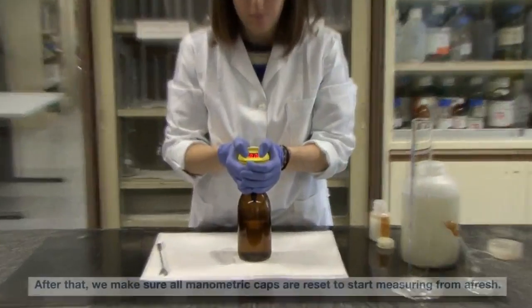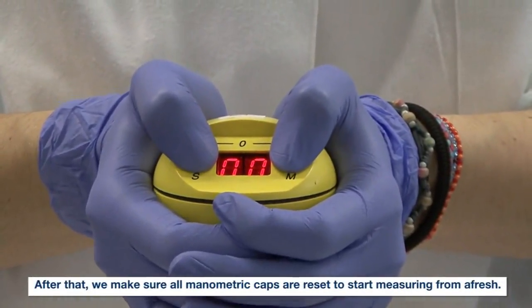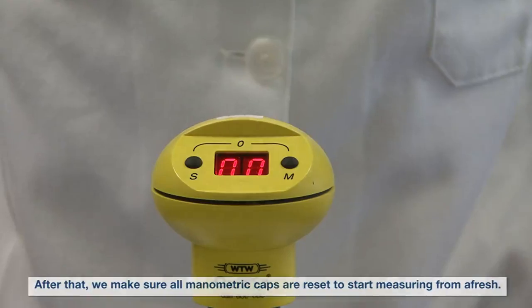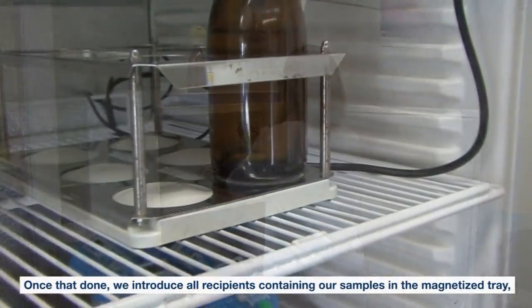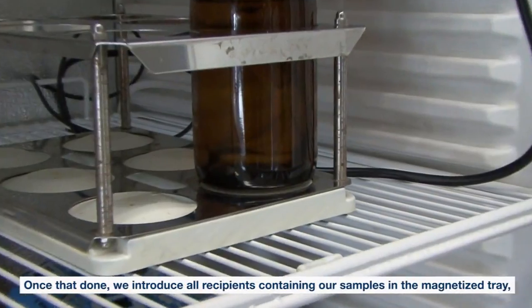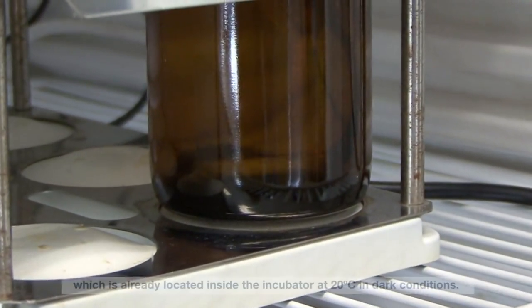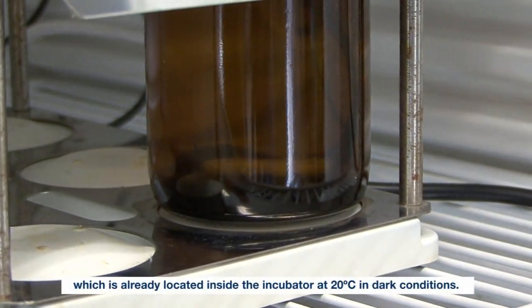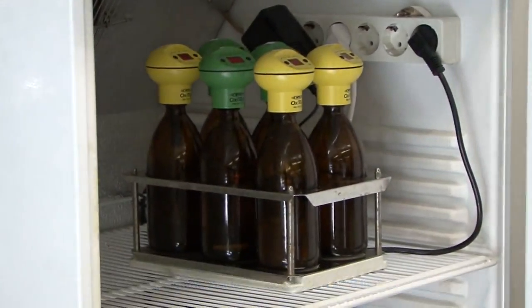Next, we can proceed to firmly close the bottles to guarantee an airtight environment inside. After that, we make sure all manometric caps are reset to start measuring from afresh. Once that's done, we introduce all recipients containing our samples in the magnetized tray, which is already located inside the incubator at 20 degrees Celsius in dark conditions.